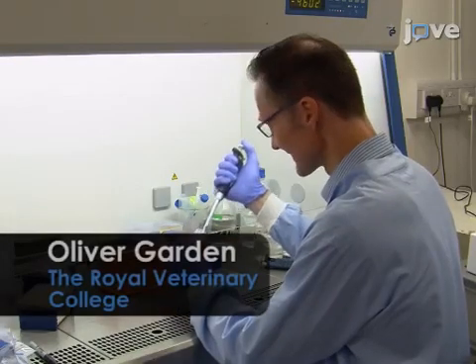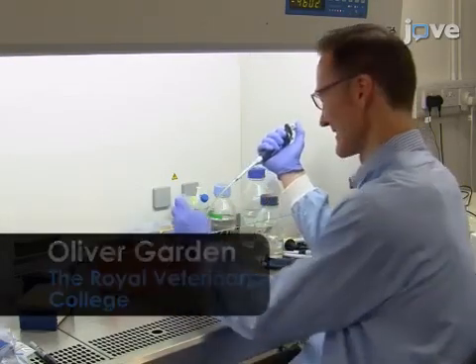We have used this technique to analyze the function of microRNAs, which are important regulators of gene expression. Using retroviral transduction, we have been able to test the function of individual microRNAs in helper T cell differentiation. My collaborator, Oliver Garden, will be demonstrating primary T cell isolation, and I will be demonstrating retroviral transduction.